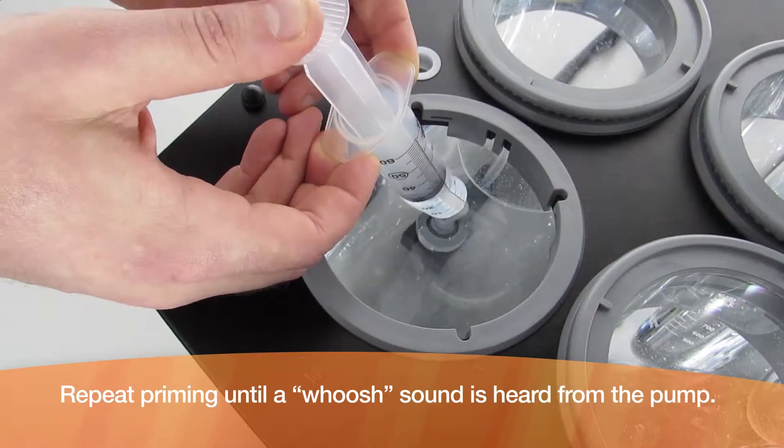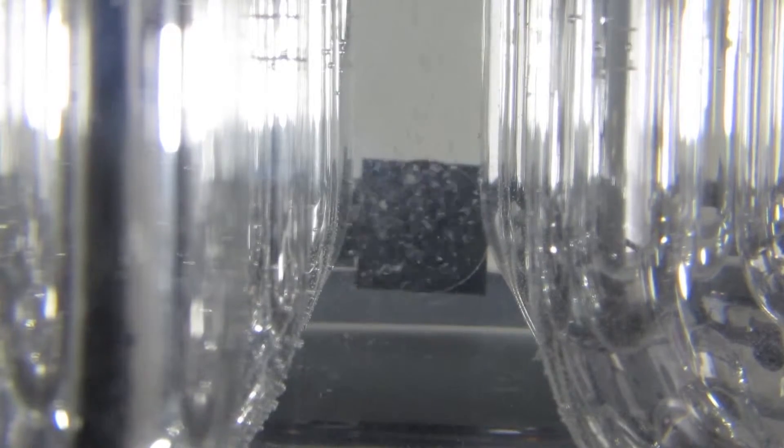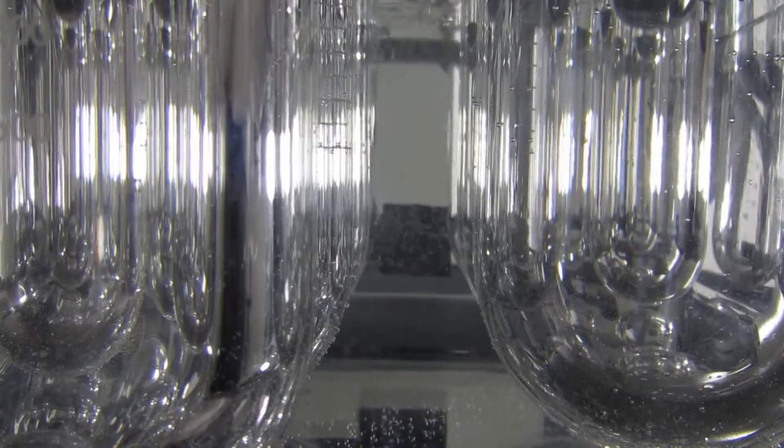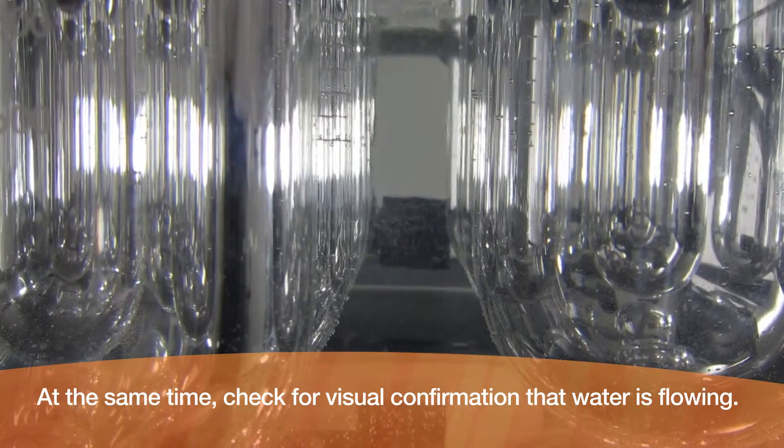Repeat priming until a whoosh sound is heard from the pump. At the same time, check for visual confirmation that water is flowing.